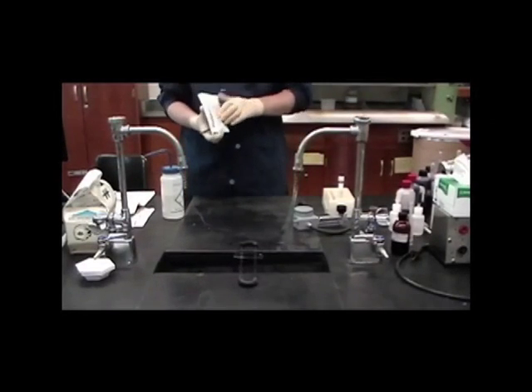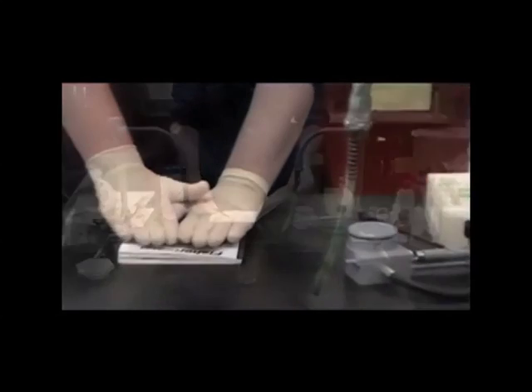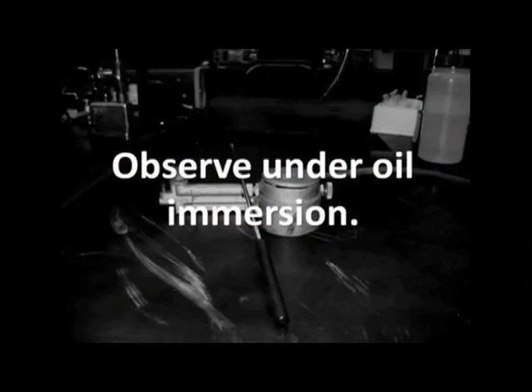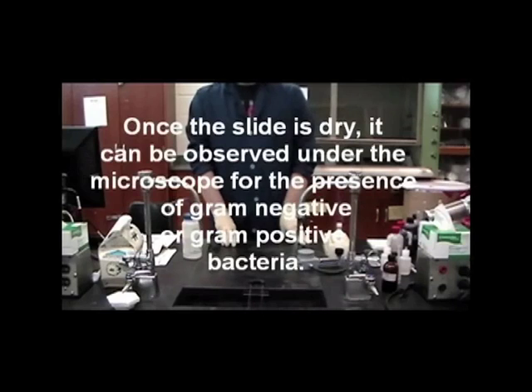This procedure is to dry the slide for observation under the microscope. Once the slide is dry, the slide can be observed under the microscope for the presence of gram-negative or gram-positive bacteria.